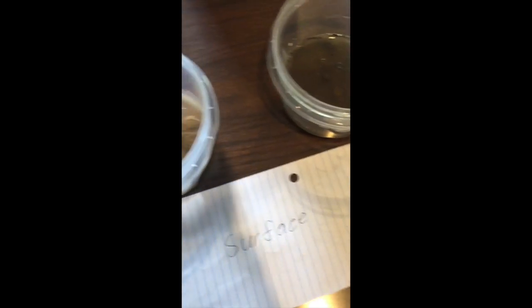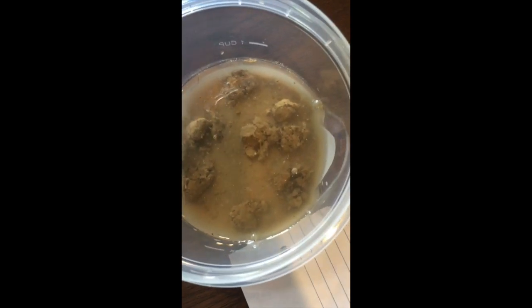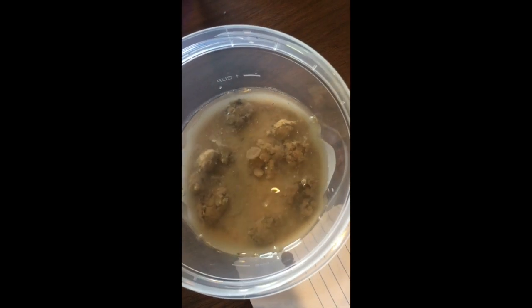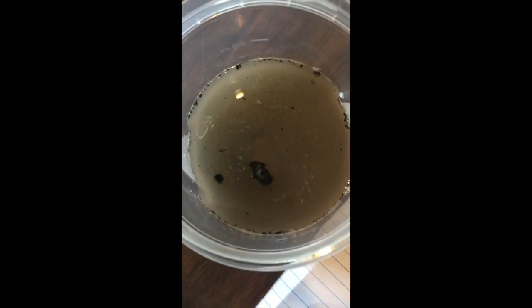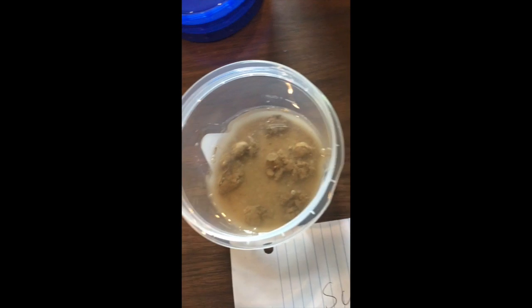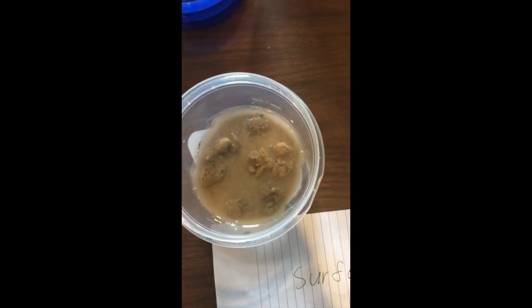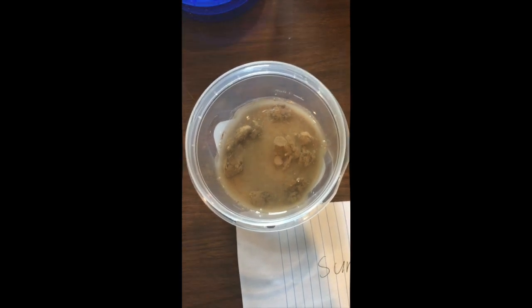So here is us at the 2 hour mark with the slaking and the aggregates in the bowls themselves. You can kind of tell there is slaking going on. It's a little harder to see in the forest soil just because the water is so much murkier, but I'll be able to drain it and tell a little better. But you can definitely tell in the field soil, from the subsoil to the surface, there is a good bit of slaking going on. I don't know if it'll be total dispersion, but it'll definitely be partial.